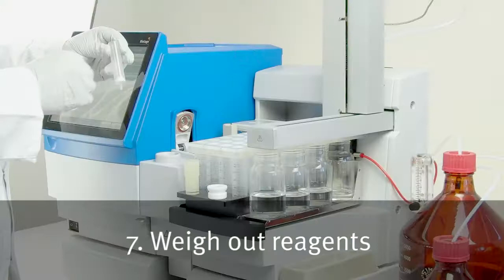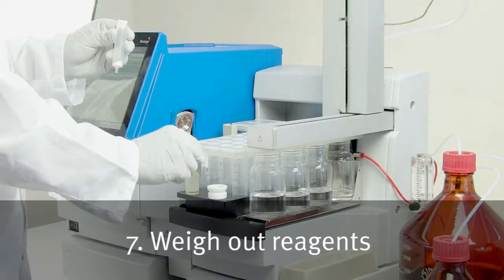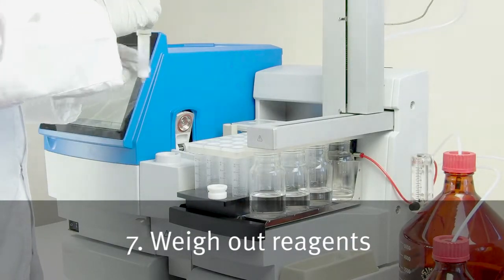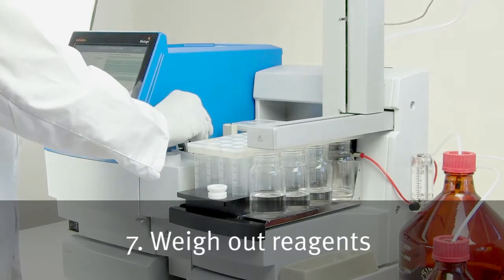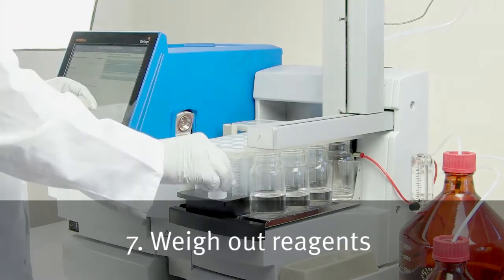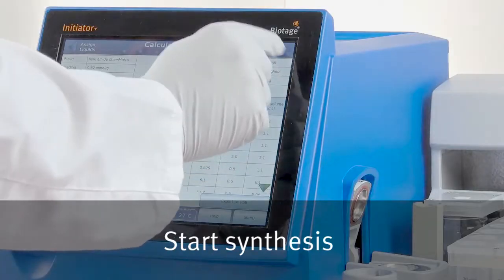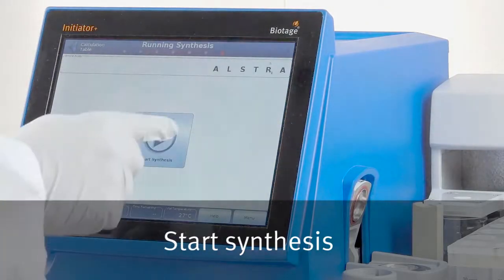Now, weigh out and dissolve the reagents and place in the appropriate position on the rack. Start the synthesis. It's as simple as that.